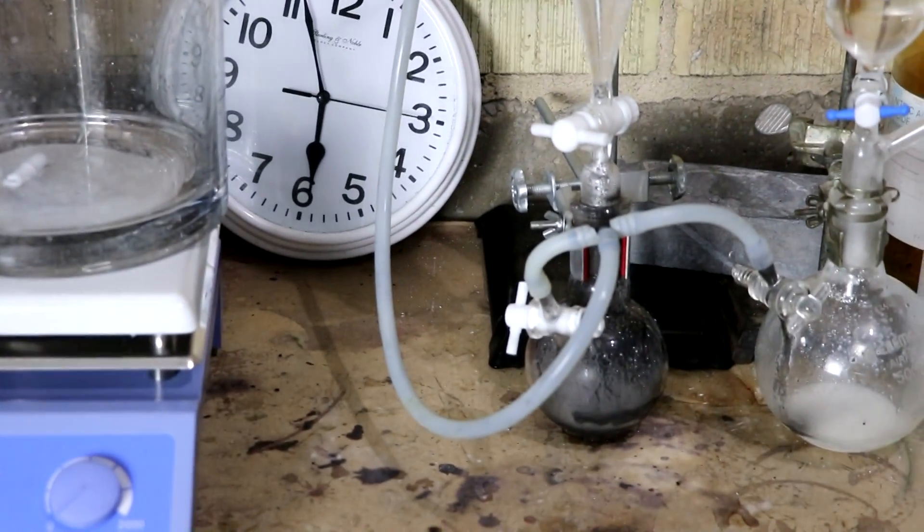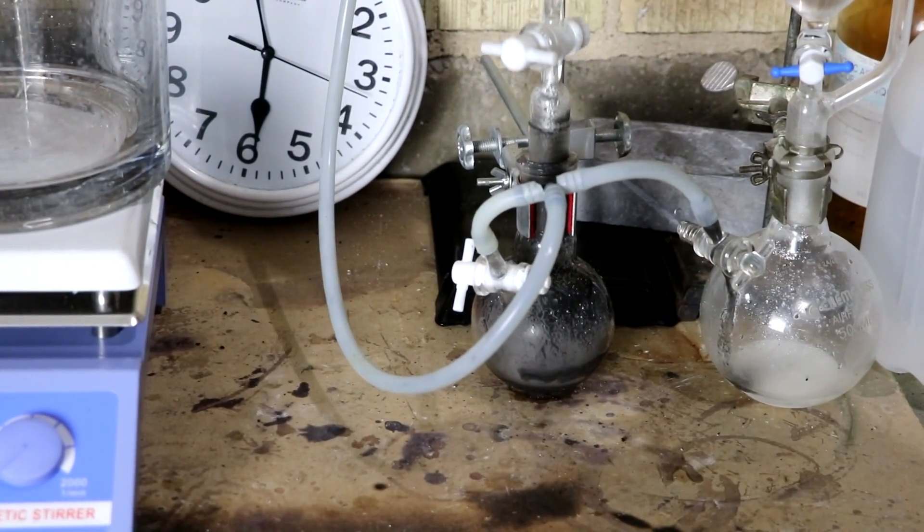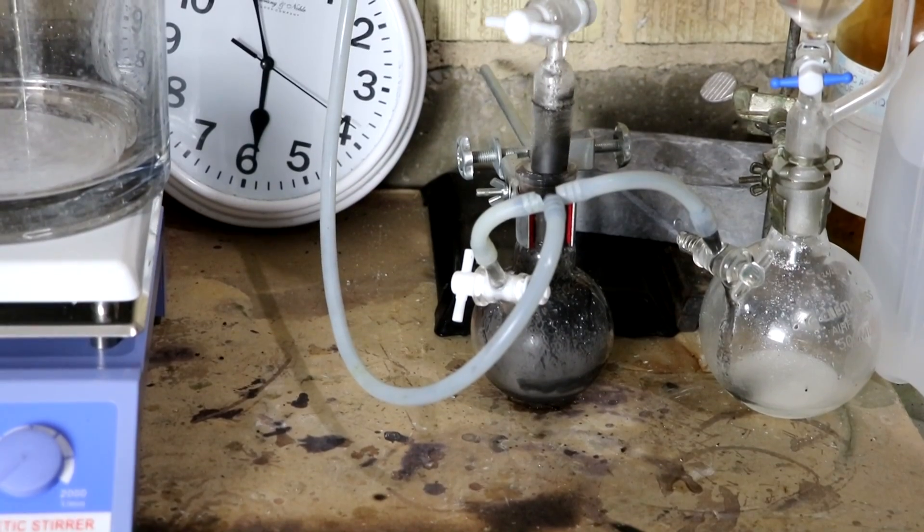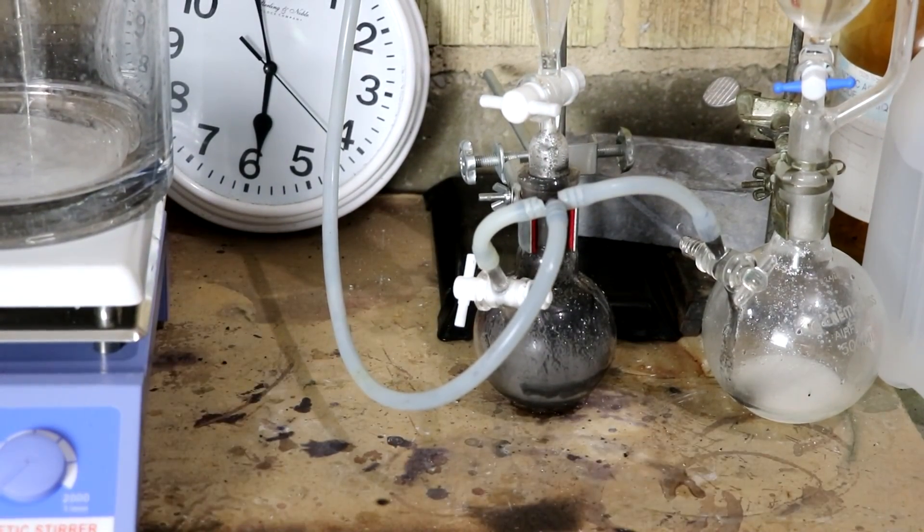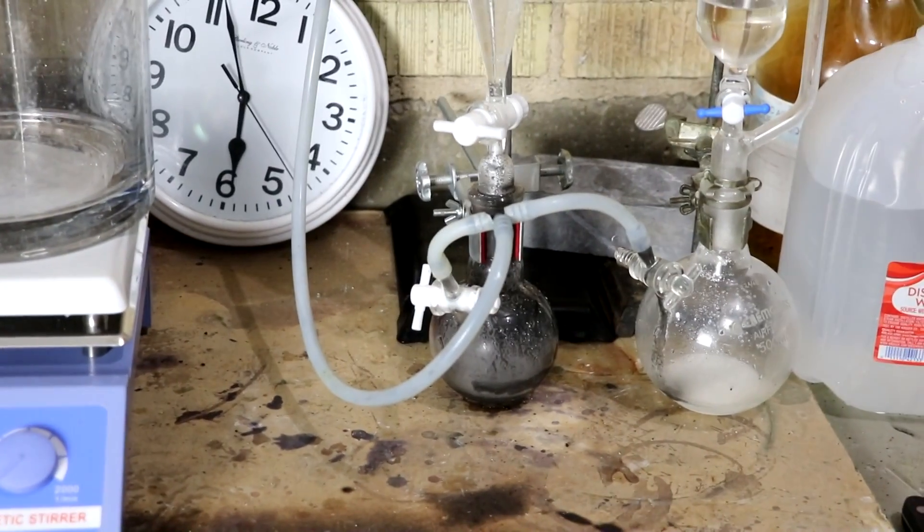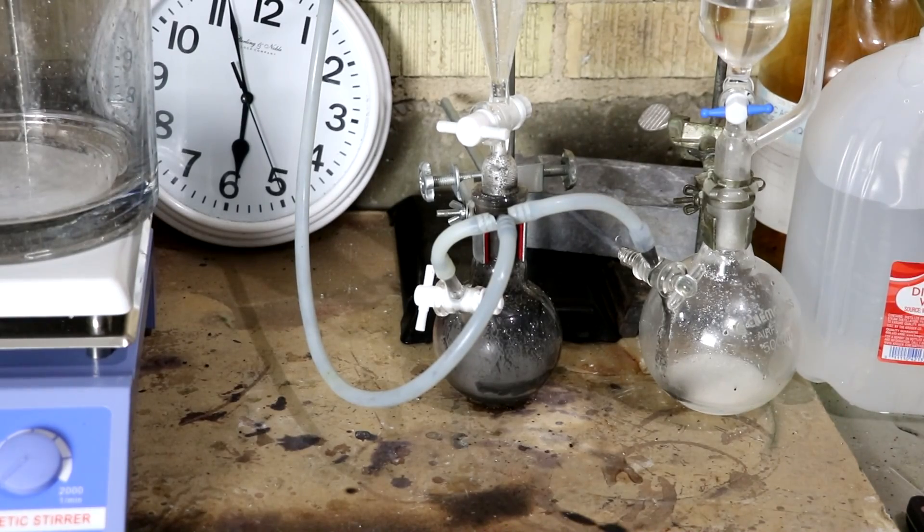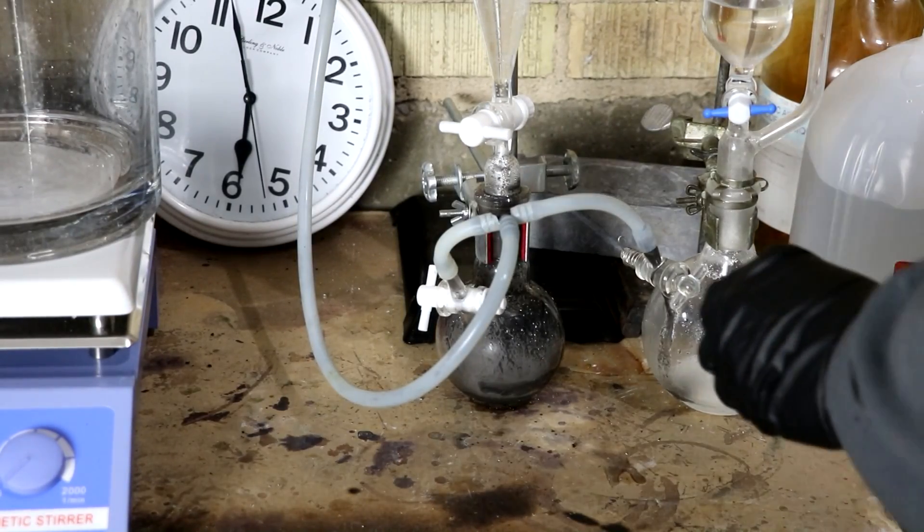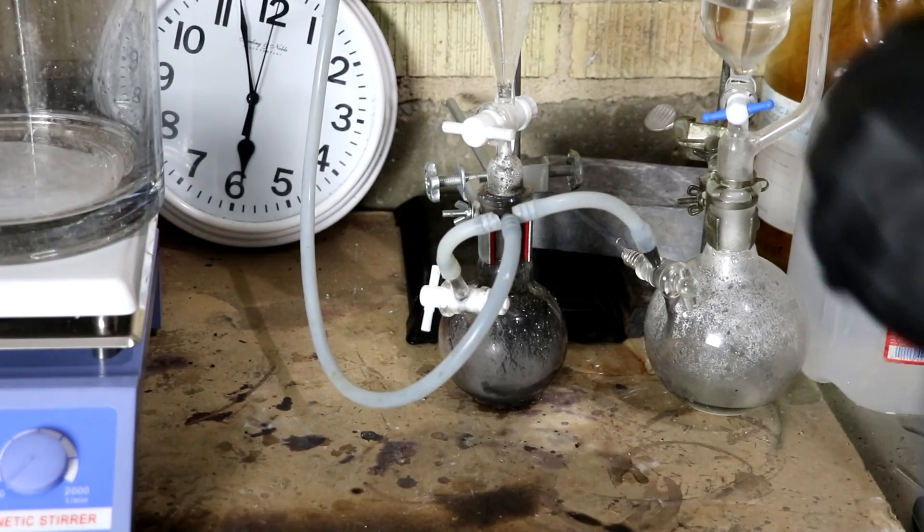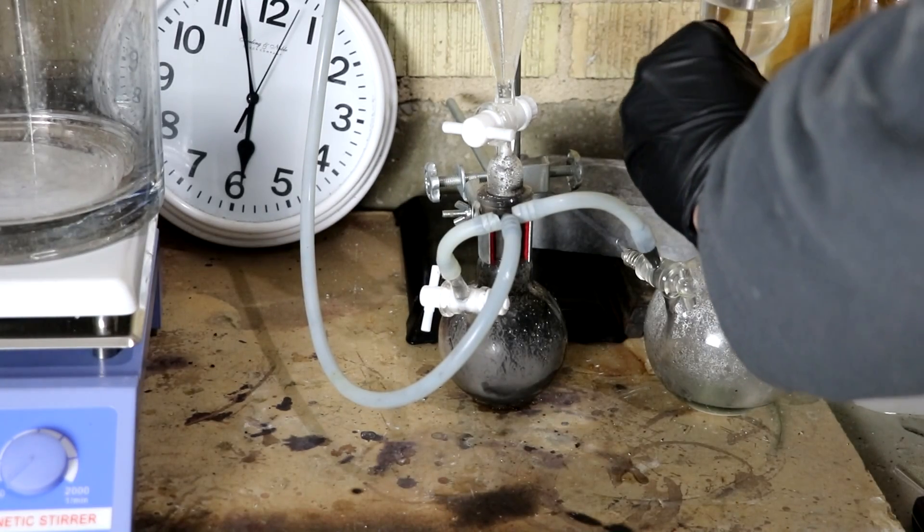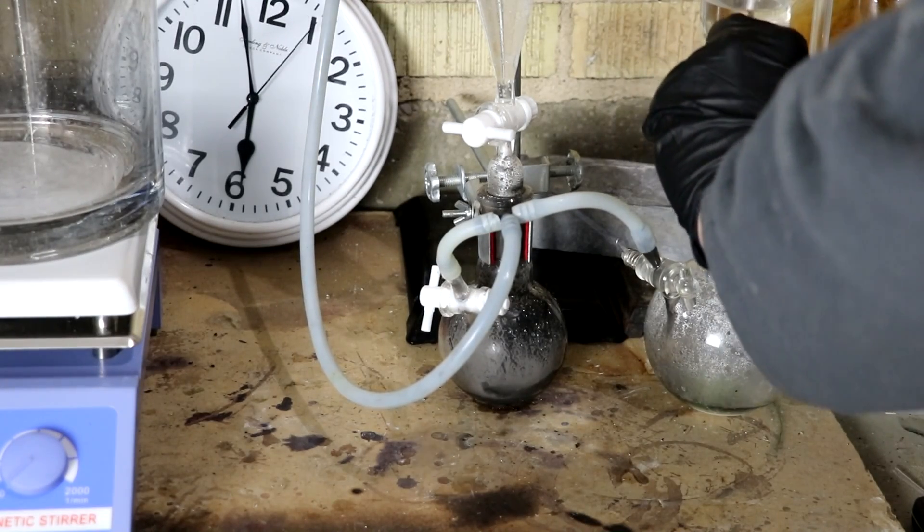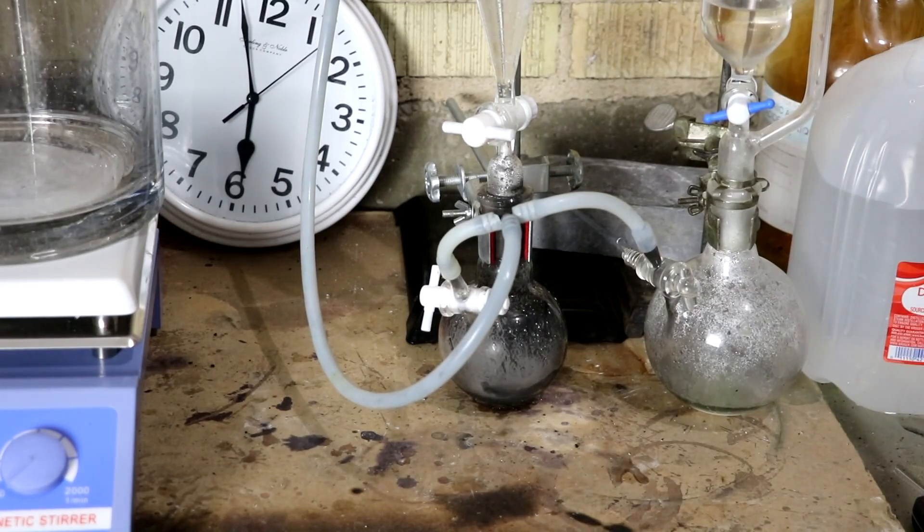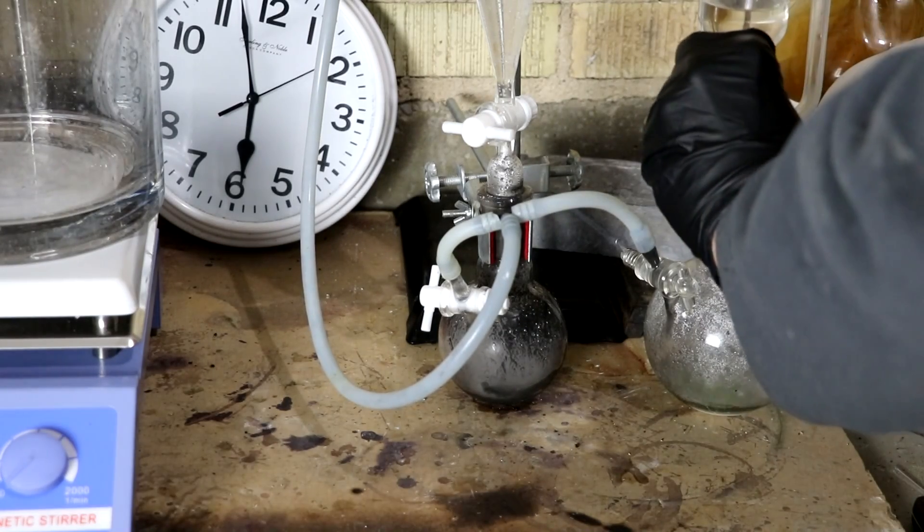I ended up actually taking the separating funnel out of there so that I can relieve the pressure. The reaction was continuing a little bit more than I would like. So now we're going to put in the sulfur dioxide. Okay, looks like it's working.